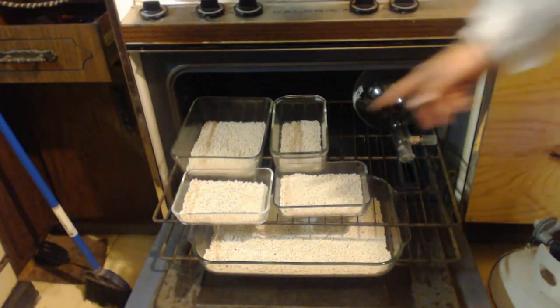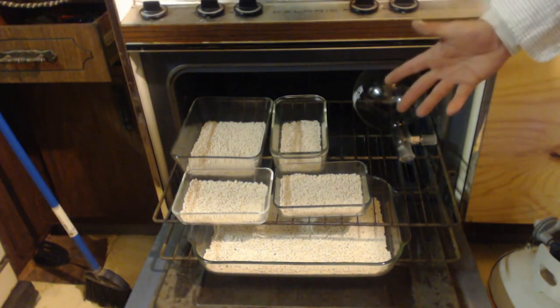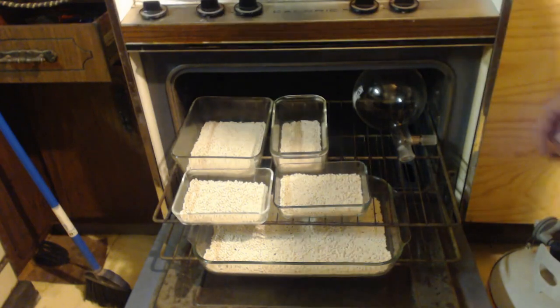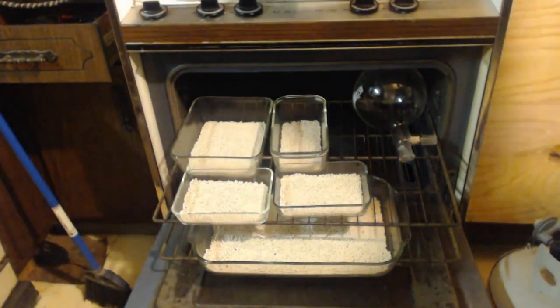You can do it both at the same time. Just put these in here and put a vacuum on it and heat it up while the vacuum is on there. But we're going to do it this way. We'll try it next time I'll do it the other way.